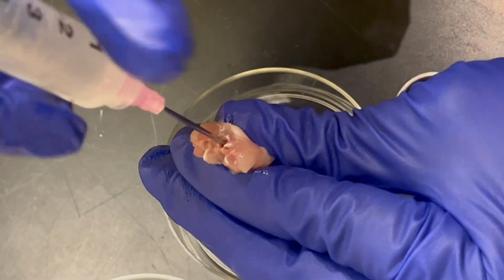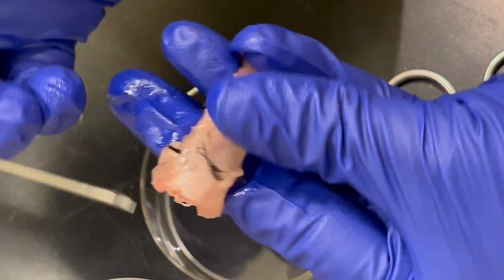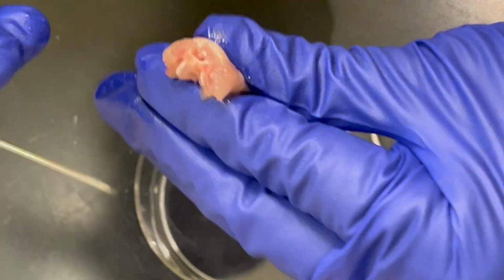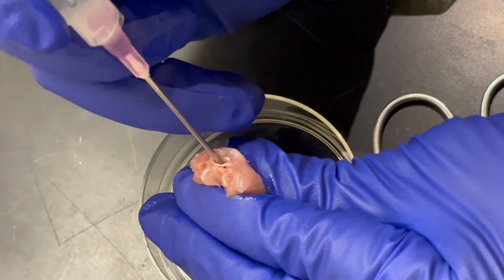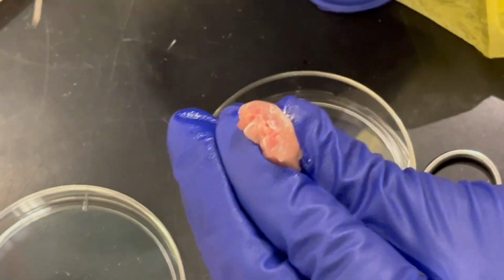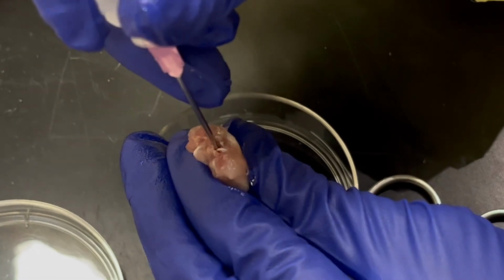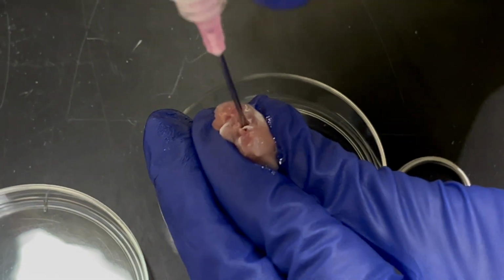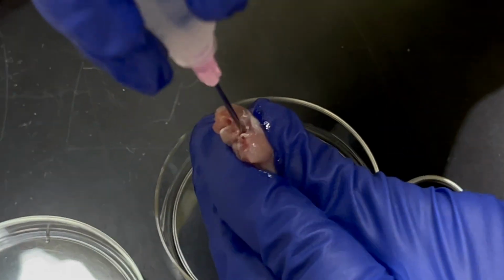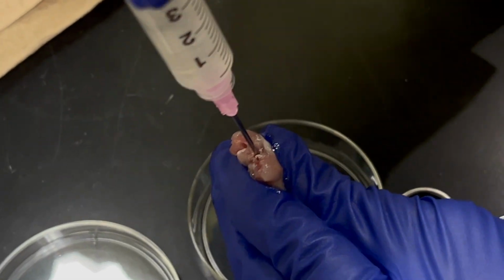This is where you want to be very careful, because if you're not careful, you're going to end up perforating the needle into your finger. That's why the clean cut is important. If you accidentally break it rather than cutting it, the needle is able to make quite a bit of space. You don't want that. You want the needle to fit into the vertebral column really nicely, so that when you put the pressure, it comes out. Okay.